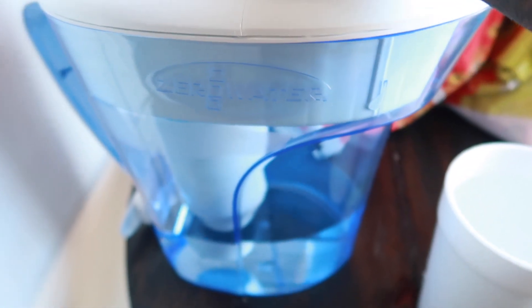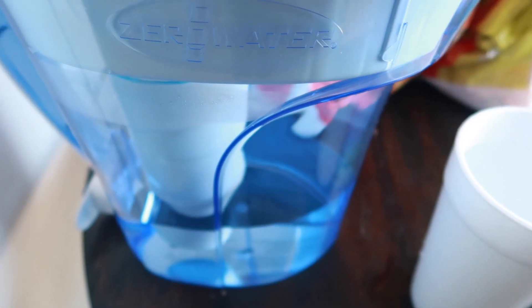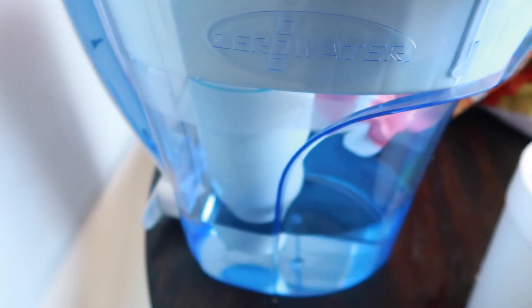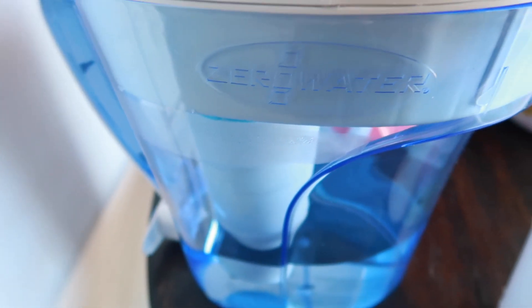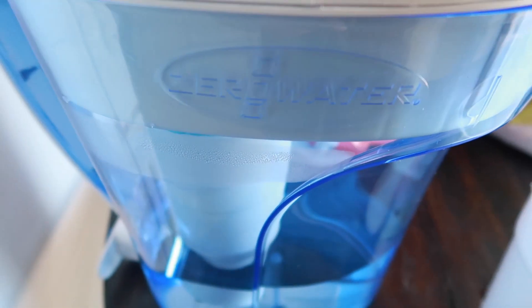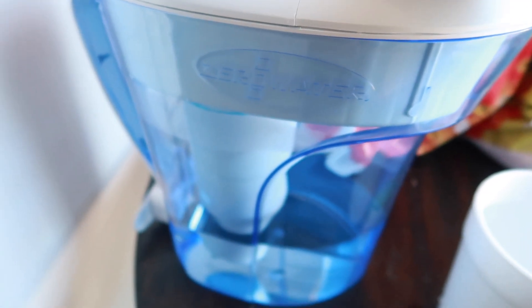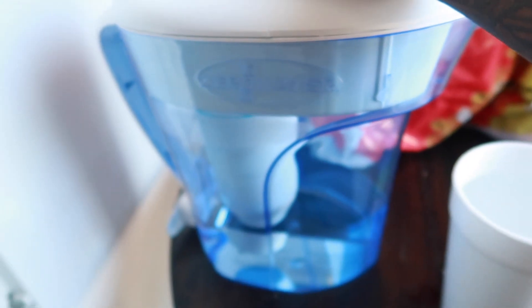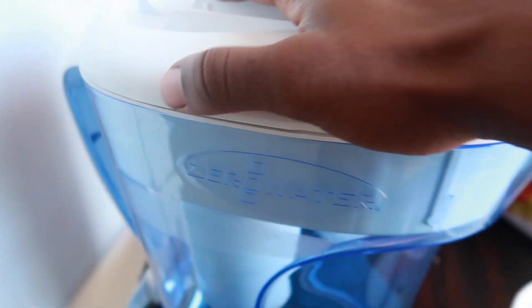When it comes to water purification, you want zero dissolved solids in your water. For example, a lot of times with tap water, if you leave tap water in a cup and it dries out, it'll leave some white ash or white residue behind — that's a dissolved solid. You don't want to drink dissolved solids because that could be any type of bacteria in the water.